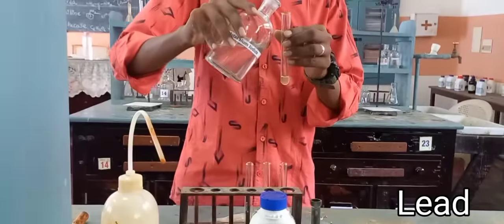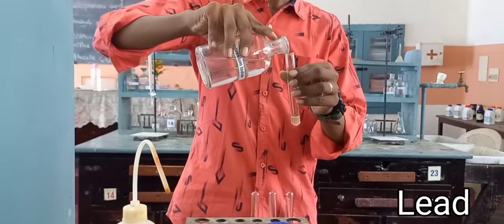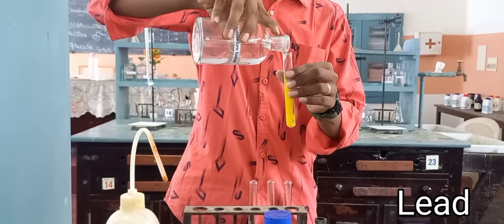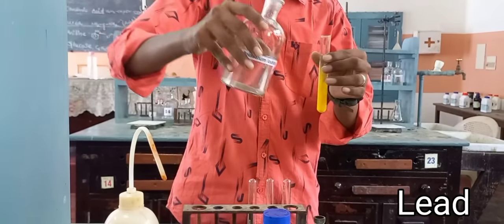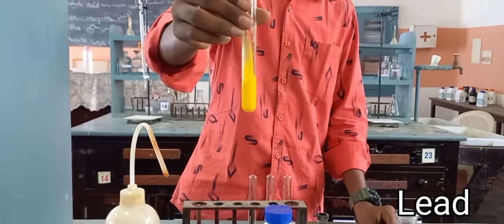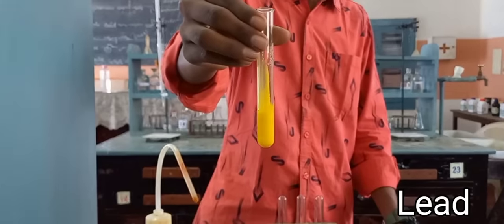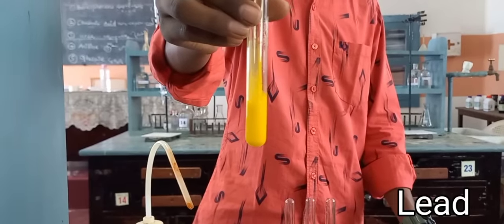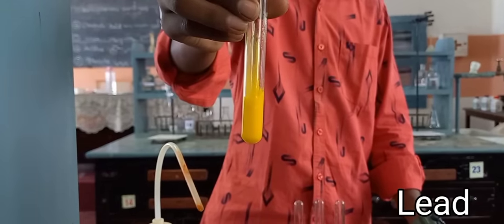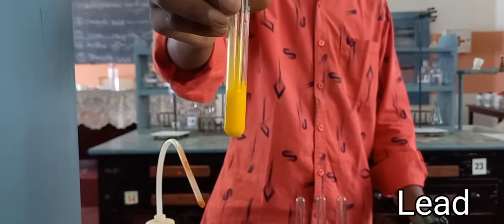To the original solution, add potassium iodide. Add it immediately — a precipitate forms. Lead is confirmed. So for lead nitrate salt, both the acid radical and basic radical are confirmed.